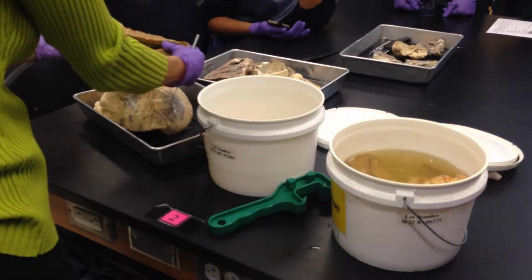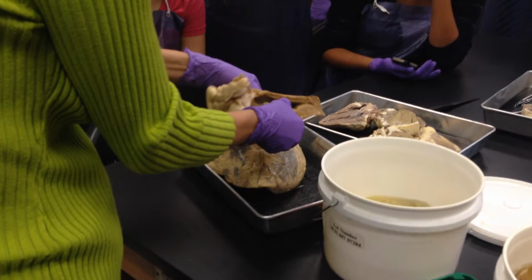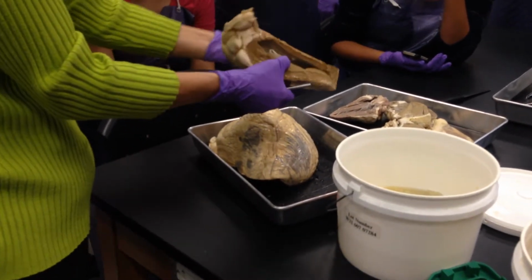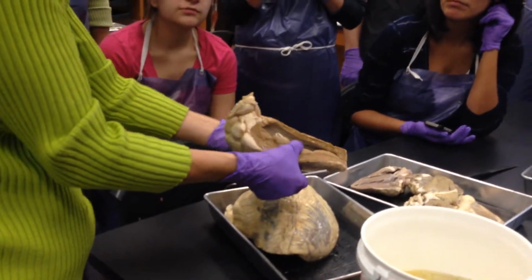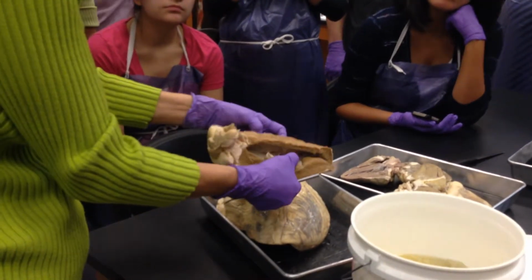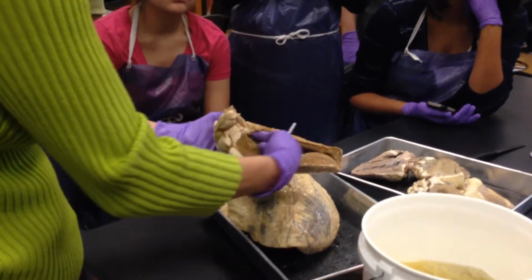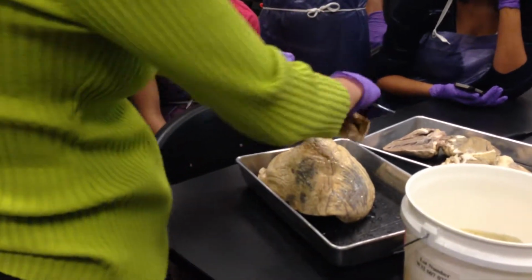All right, so again, we're looking at that interventricular septum. Which ventricle is which? This is the right one. This one over here is the right, good, Kiara, and this side over here is the left. And then again, you can see the same structures in there. Look at this right here, this is the aorta. The aorta is the blood vessel where blood leaves the left ventricle and goes out.